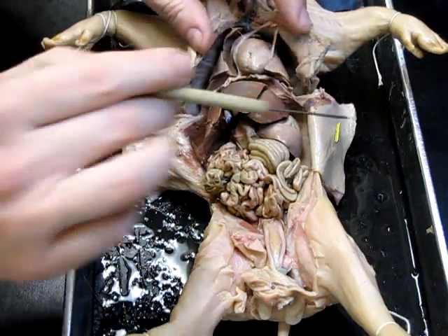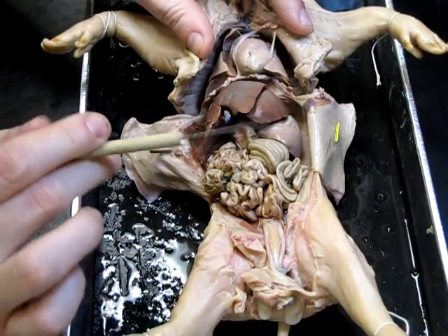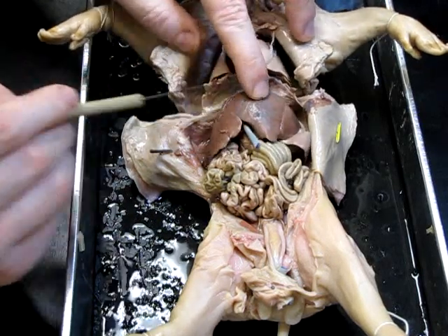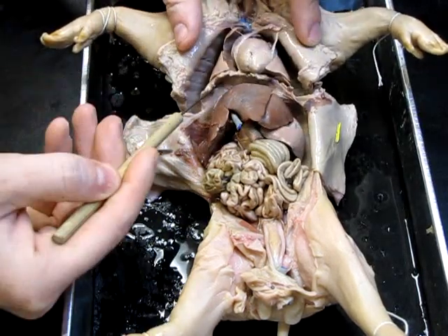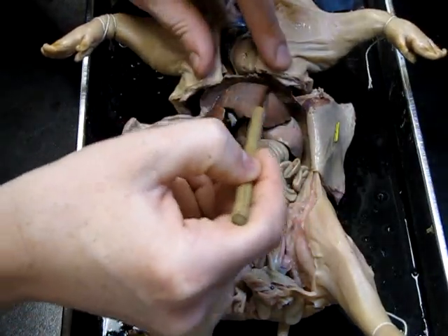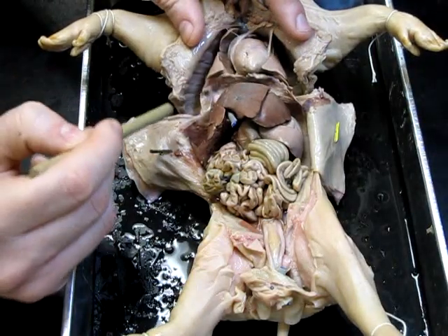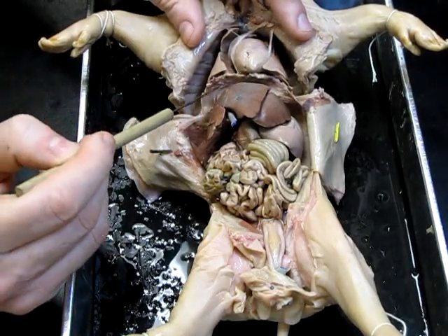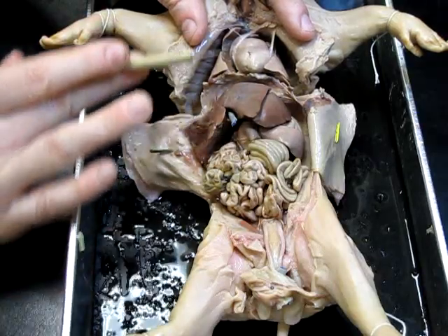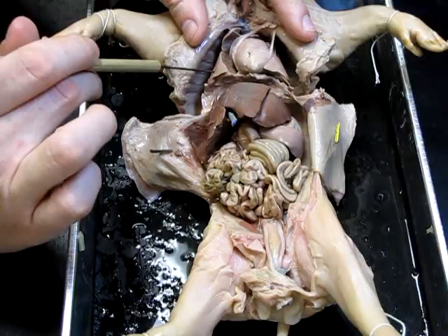To determine which cavity you're looking at, the first thing you should locate is a muscular wall called the diaphragm. We can see the diaphragm right here — it was in fact attached to the chest wall above as well. This is a unique structure to mammals, and muscular movements up and down of the diaphragm are what inflates and deflates the lungs.